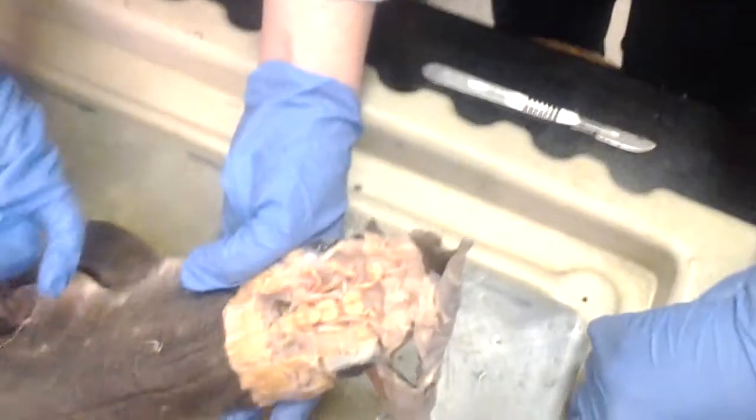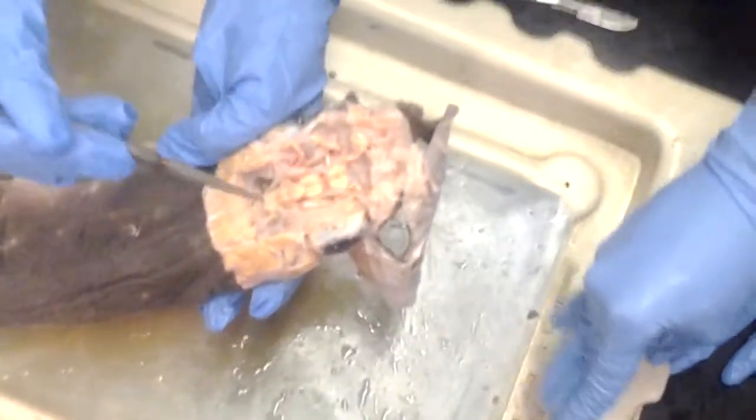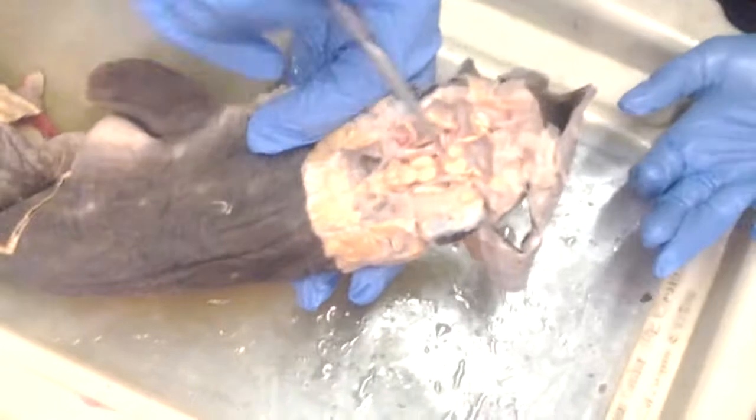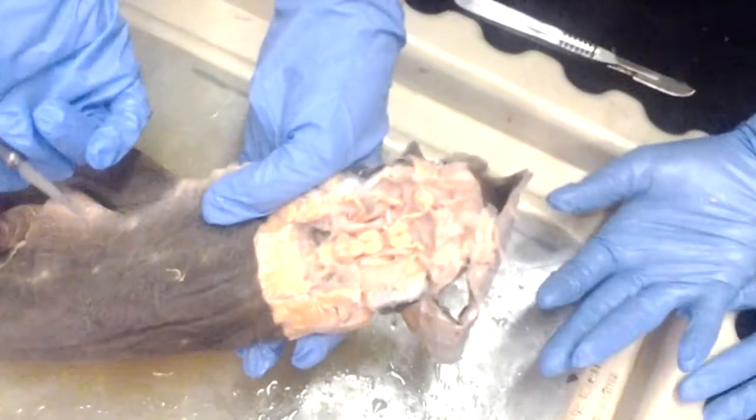So this is the medulla oblongata, and in the middle you have another telechoroidea with the fourth ventricle. So that hole in the middle is the fourth ventricle. Do we need to know that there is a fourth ventricle inside? Yeah, it's in your book. The brain has ventricles, so it has four ventricles.